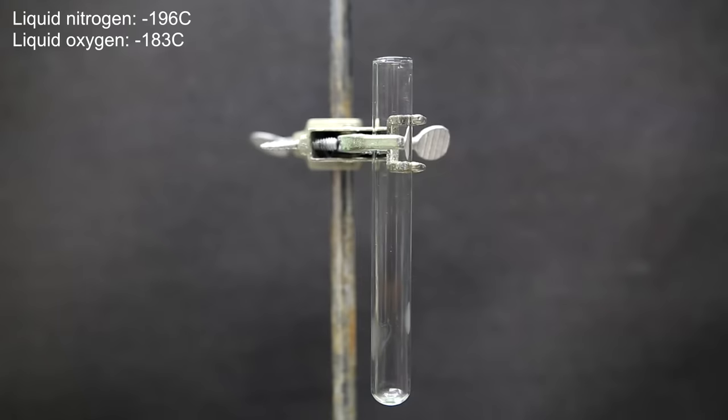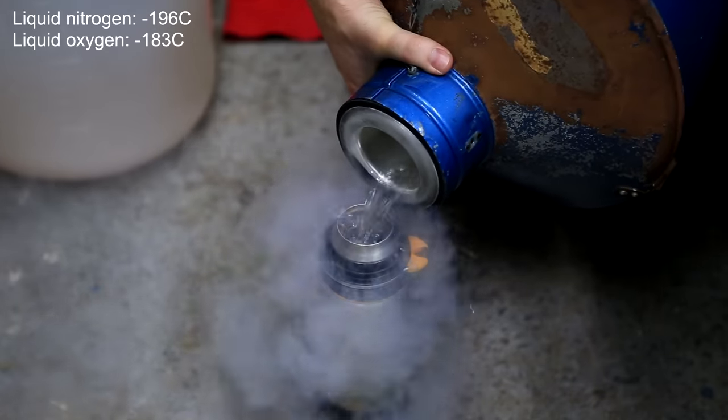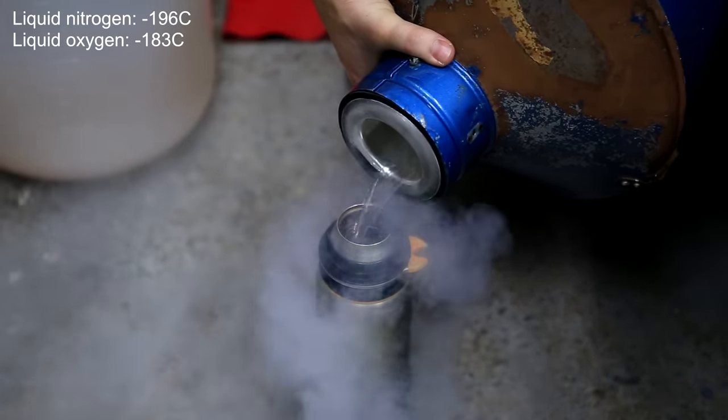The boiling point of liquid oxygen is slightly higher than liquid nitrogen, so what we're gonna do is we're gonna use liquid nitrogen to condense oxygen gas.